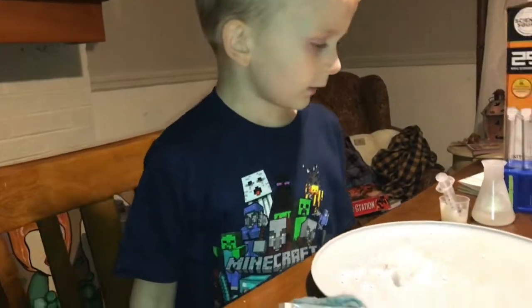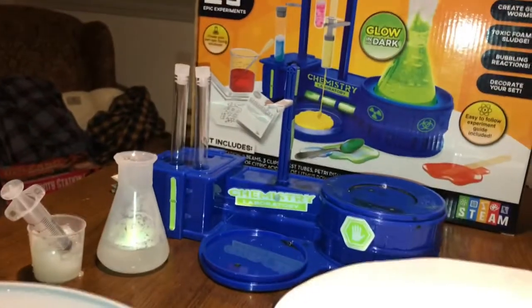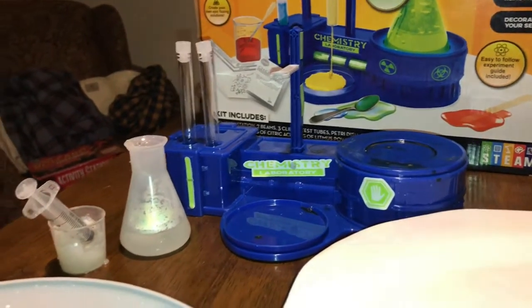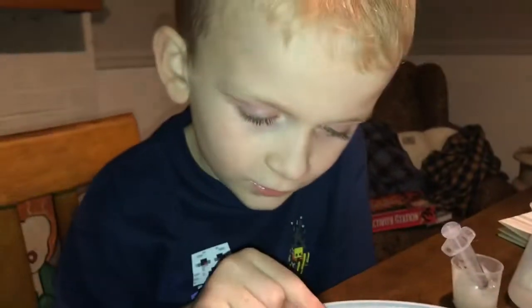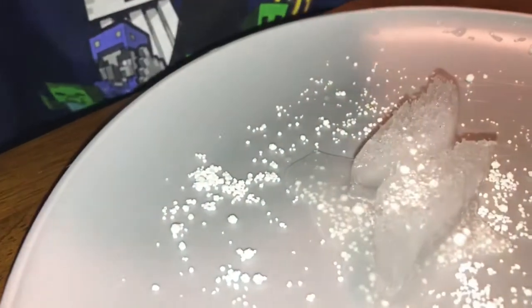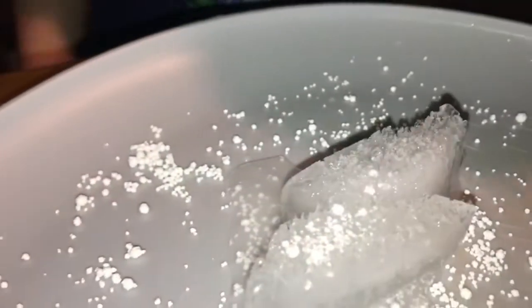Enough experiments for today, but there's way more! And this is at five dollars — that's far below. Sadly, you don't get to do this other one today, but maybe in another episode. I am still digging — still digging, still digging. That's awesome! Look, let me get a little one and put it on.